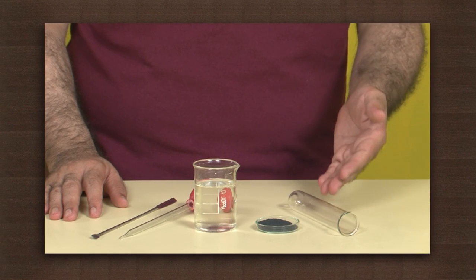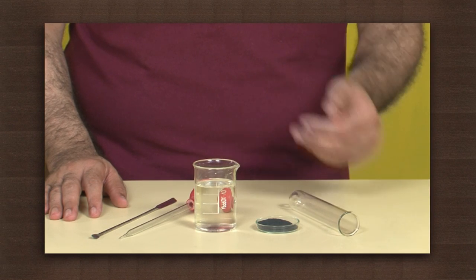We will see what happens when metal oxides react with an acid. We need a test tube, copper oxide, and dilute hydrochloric acid.